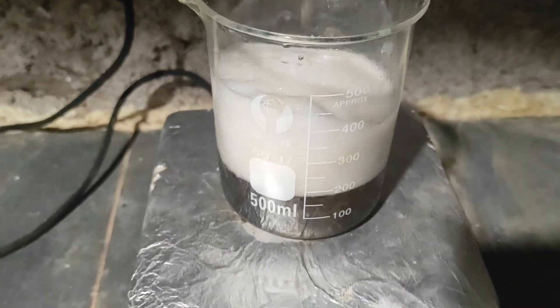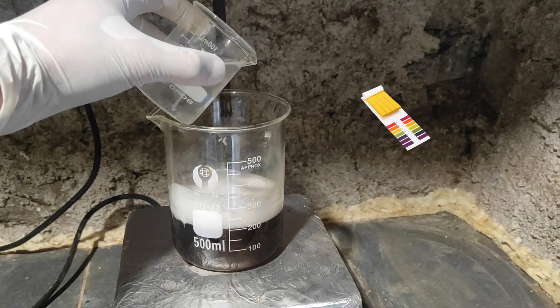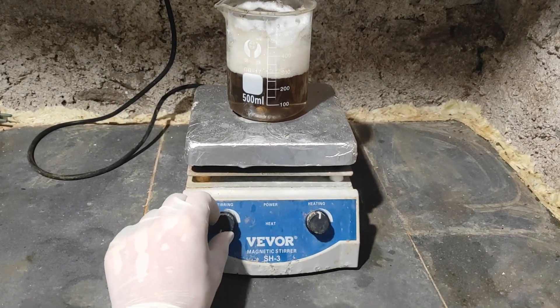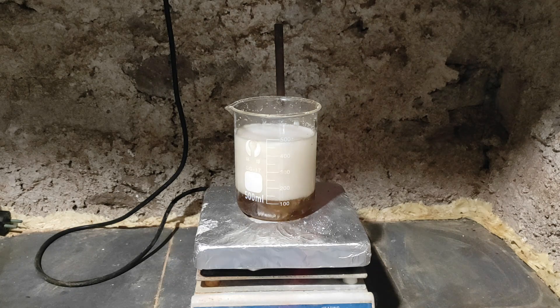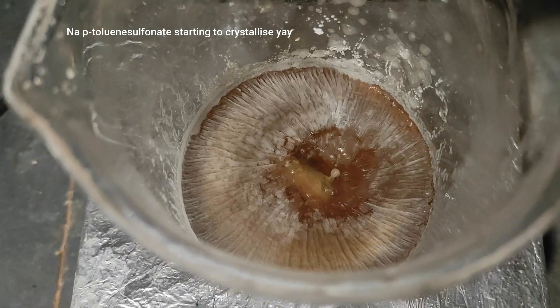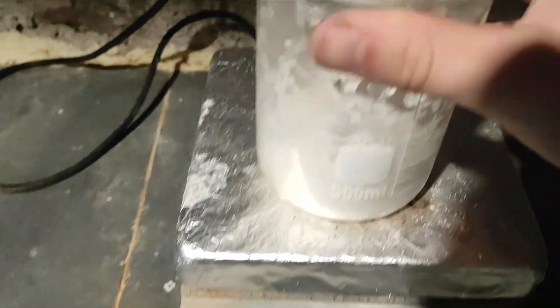To measure the reaction, you can get a rough estimate using the amount of bubbling you see, and then you just do some final adjustments until you get the pH close to neutral, which is between yellow and green on those litmus papers. When all the carbonate has been added, we can start to heat to boil off the excess water. In the end we are left with this very nice fluffy powder. It's not completely dry, so I'm going to let it on the hotplate.